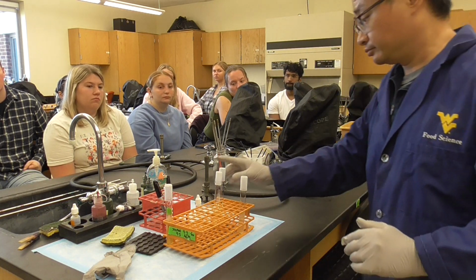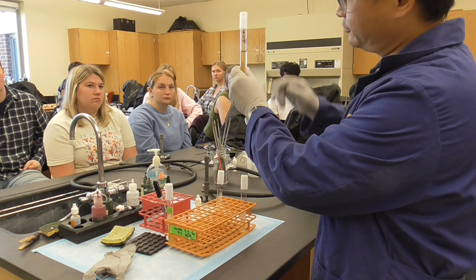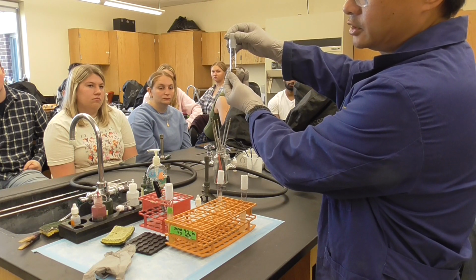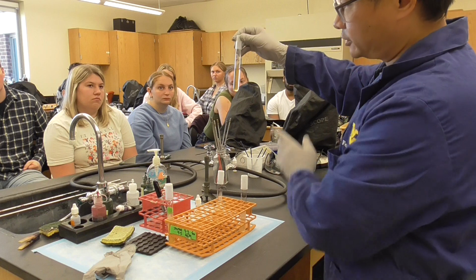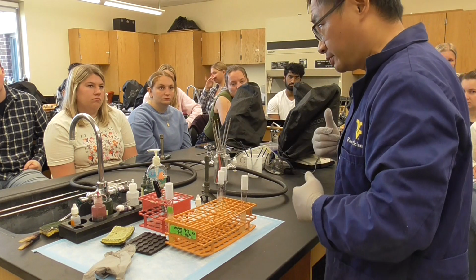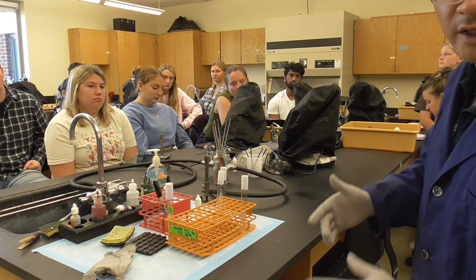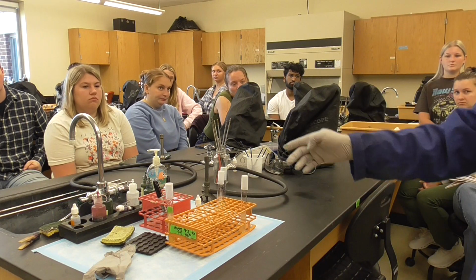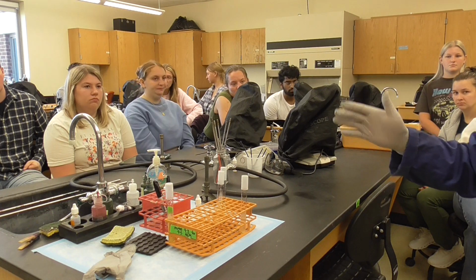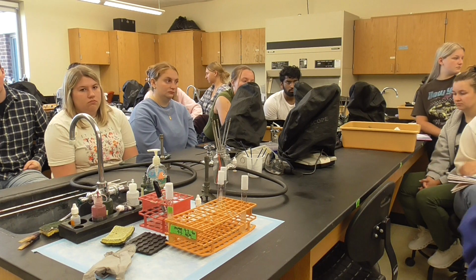One more thing. This is called a Kimble cap tube. It's very easy to fall off, so never hold it like this. Make sure you use two hands. It's very easy to fall off. This is the number 2 accident in the biological lab. Number 1 is the Bunsen burner or the like. If you drop it, let us know. Ideally it should be put in a Sharps glass box. You cannot just put it into the biohazard trash can. Okay? Something important. Okay, now go ahead to work.